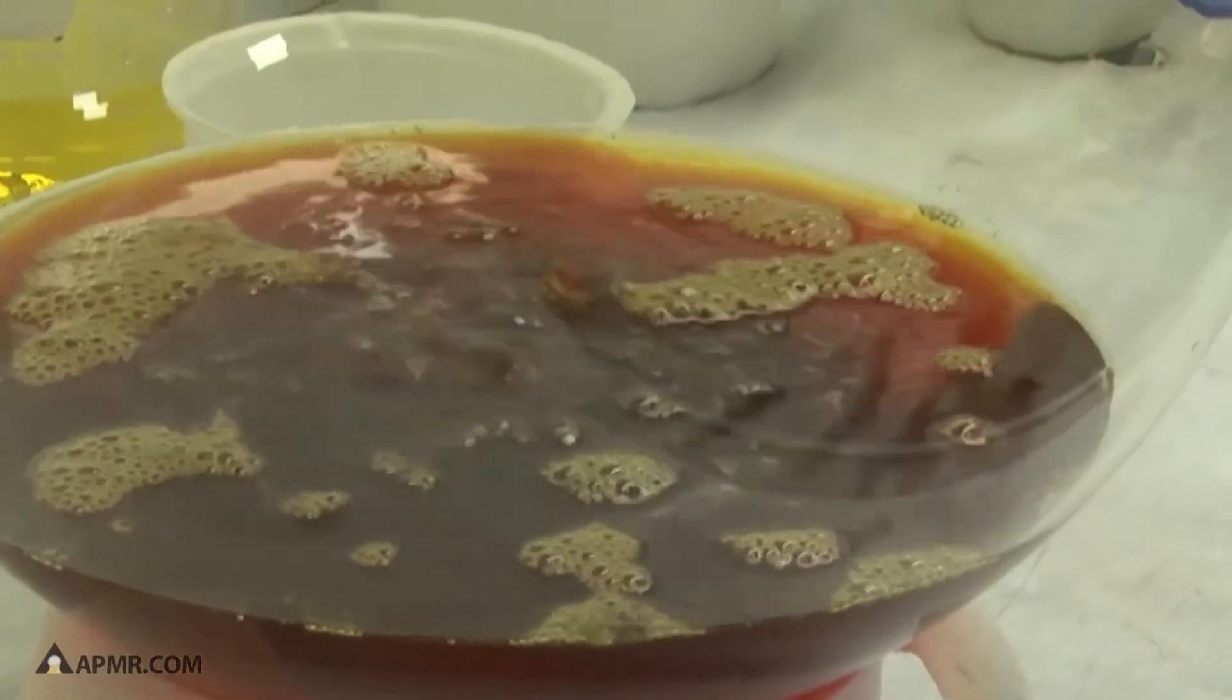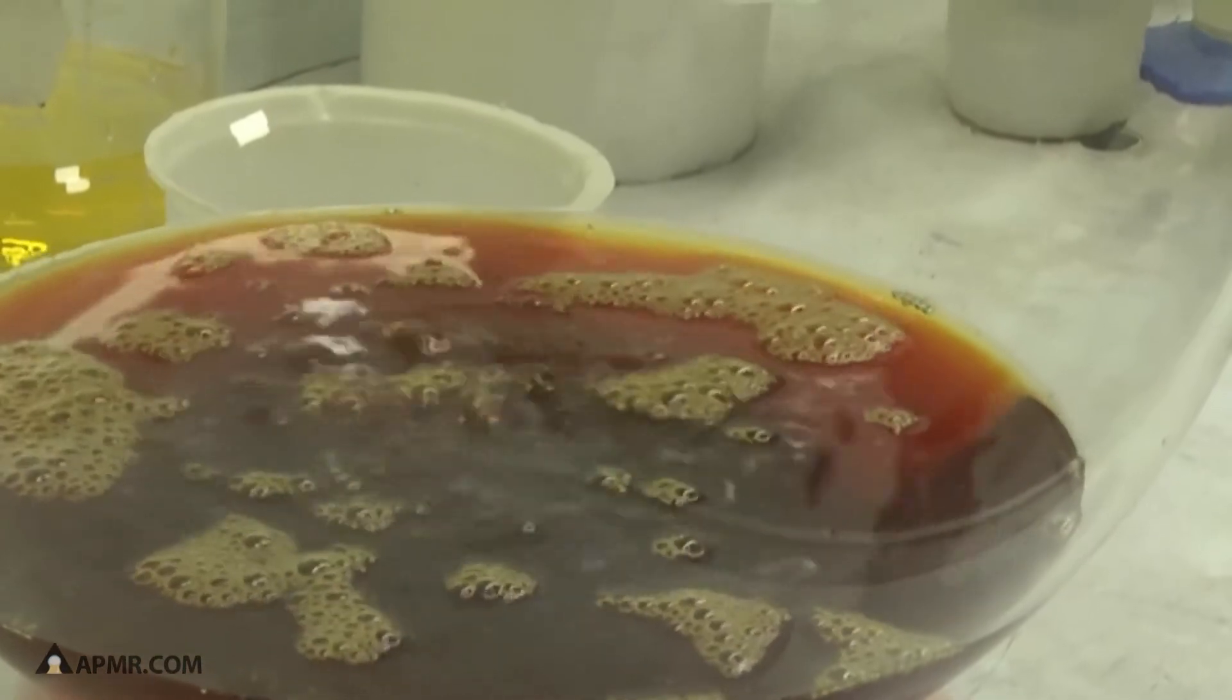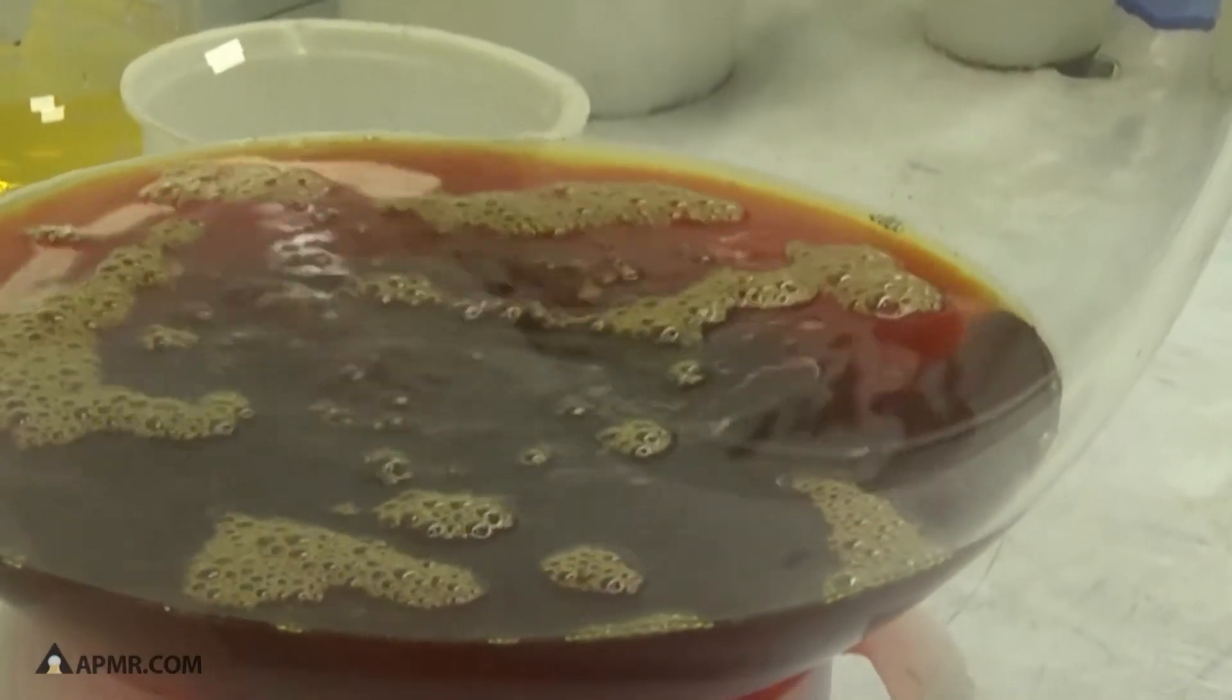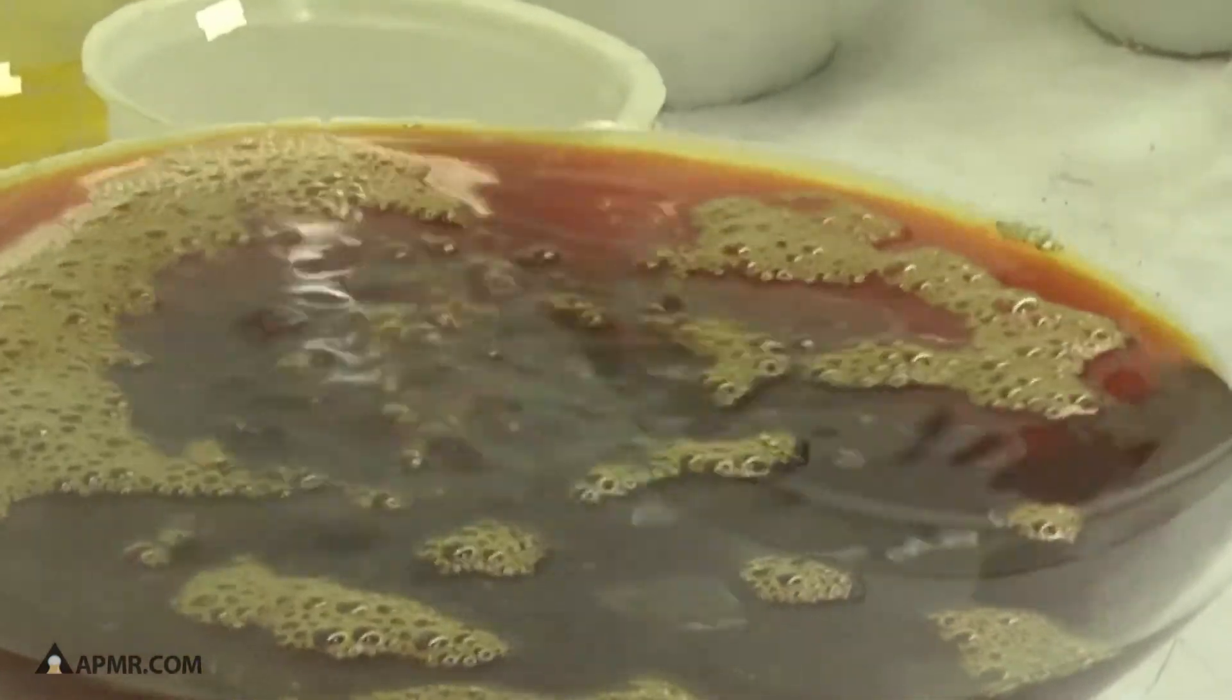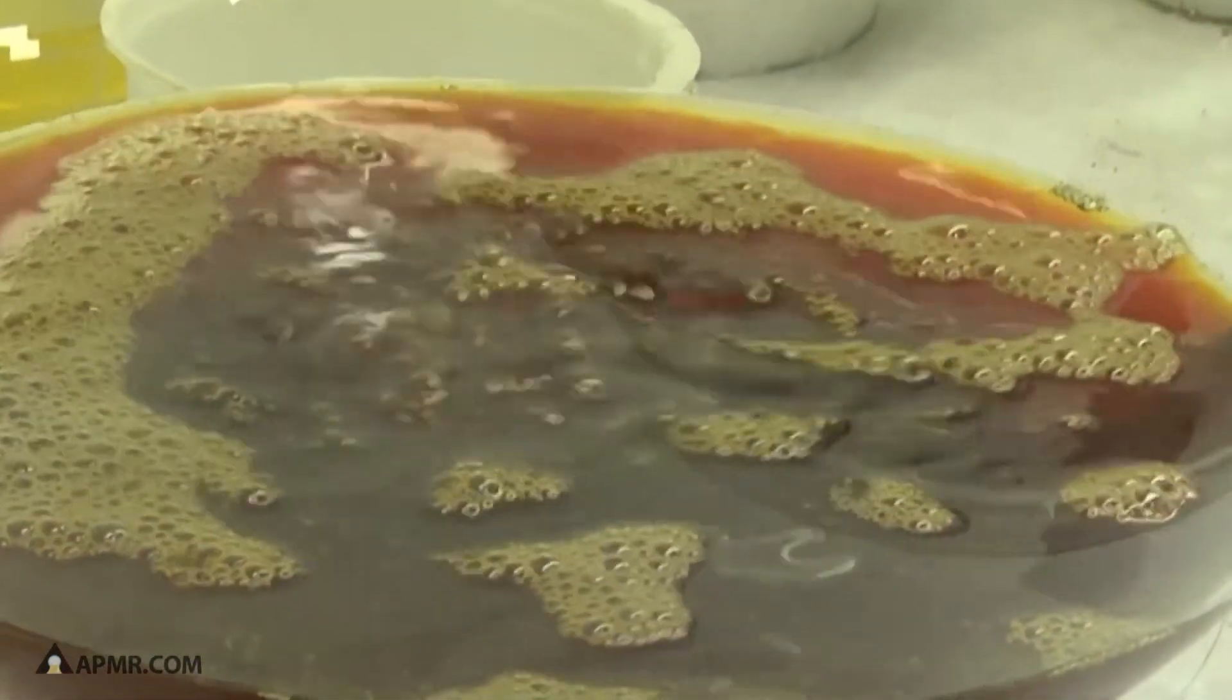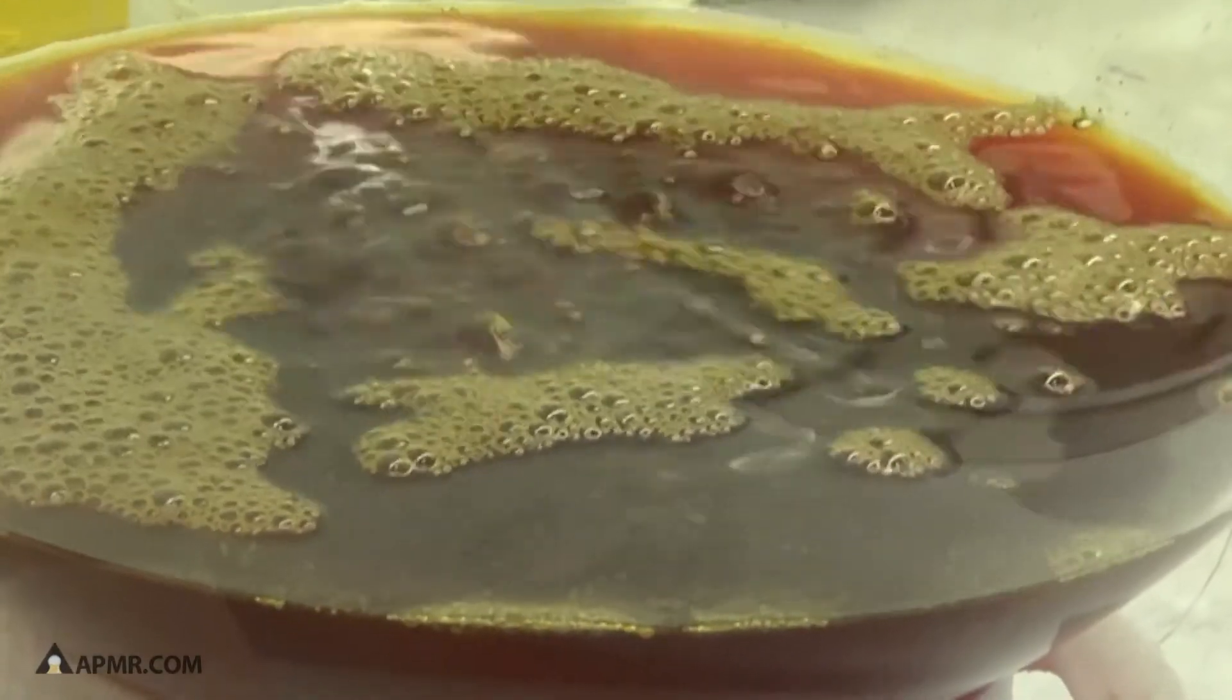So over a given period of time, maybe in the next five or ten minutes or so, the acid in that flask is going to reach a temperature of about 120 to 130 degrees Fahrenheit just from the chemical reaction.